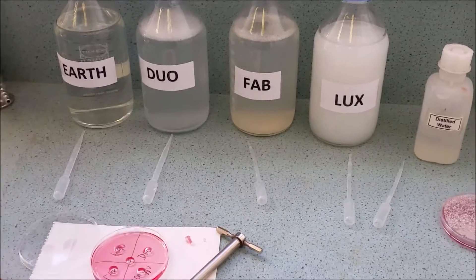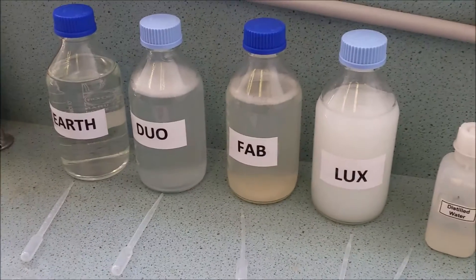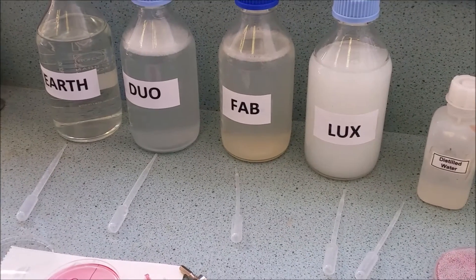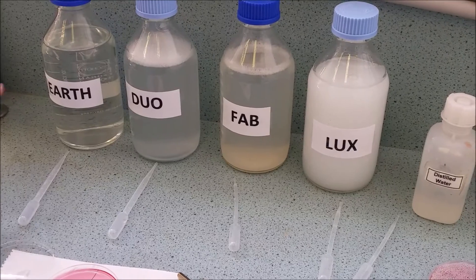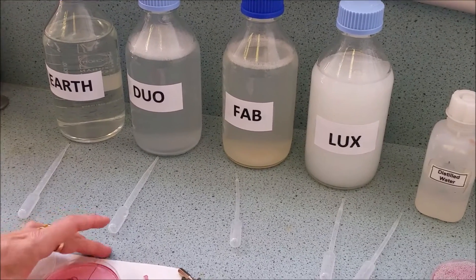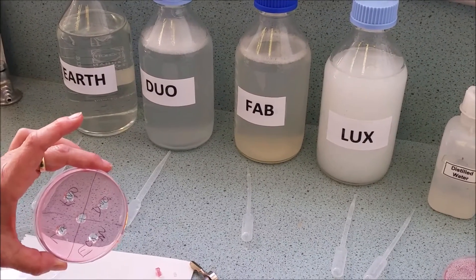Now that our wells have been created, we're now going to place each of our laundry detergent samples, one into each. It's really important to make sure that the name on the laundry detergent actually matches where you've labeled the hole.